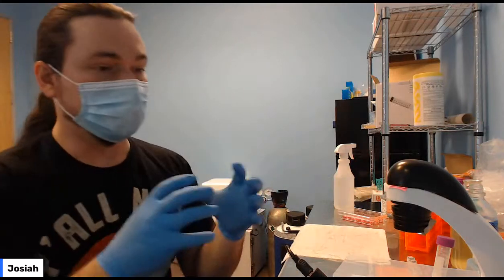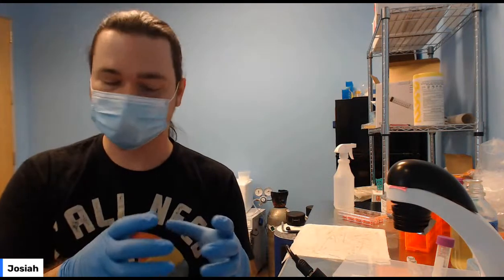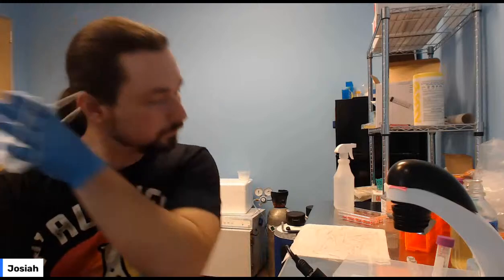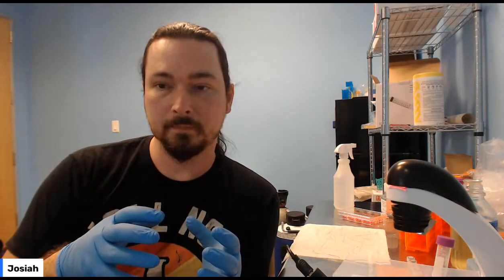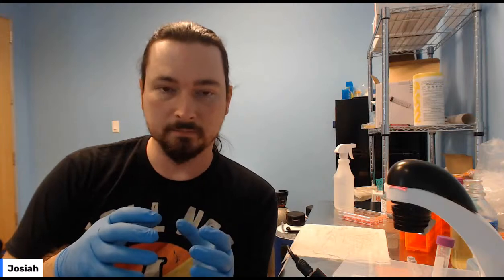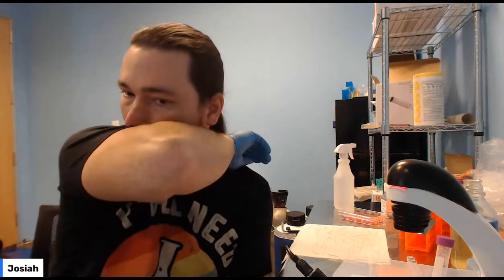If you have an incubator built, you keep a cup of water in there, and that will help keep the moisture level high. That way, things won't dry out so fast.